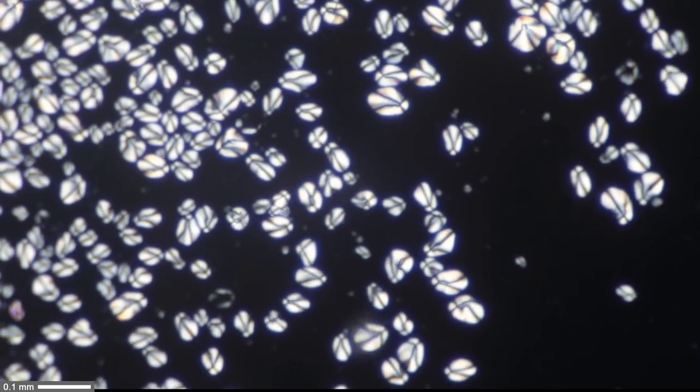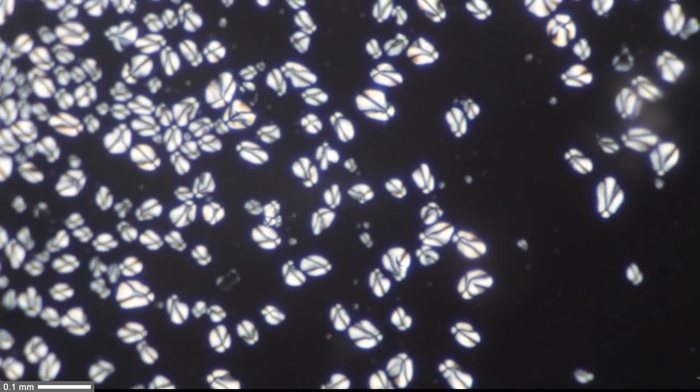When I shake it you can actually see the starch grains move a little bit because they're suspended in water.